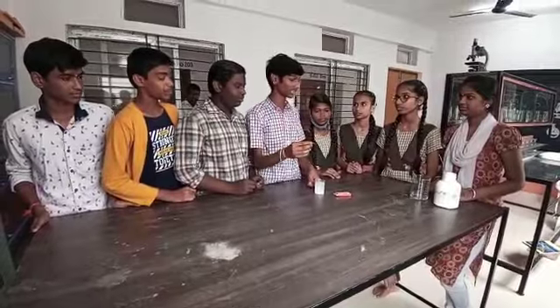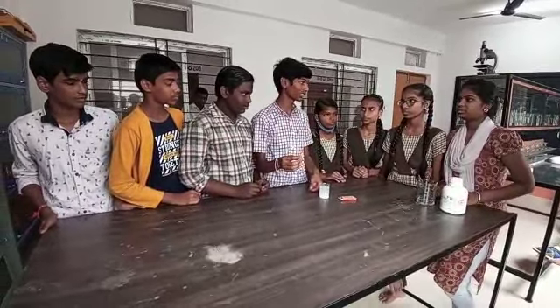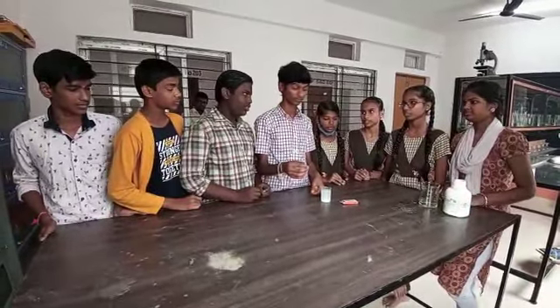So what is the nature of calcium oxide solution? Basic solution.